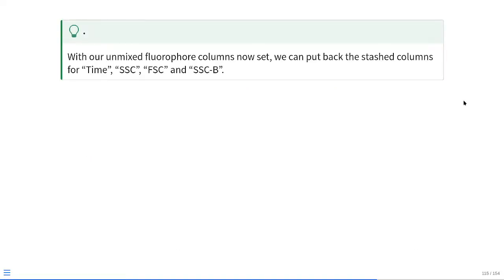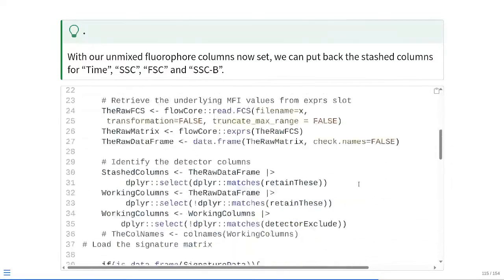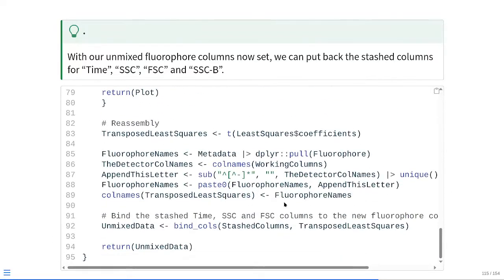So, with our unmixed fluorophore columns now set, we can take those stashed columns from very early today: time, side scatter, forward scatter, side scatter B, and just add those in alongside our existing fluorophore columns. As you may remember, we can do this with either cbind from base R or bind_cols from dplyr. Basically we want time to be the first column just because that's where it was in the raw FCS file, so that will be stashed columns as the first entry, and then adding the fluorophore columns after we've added in this data frame here.